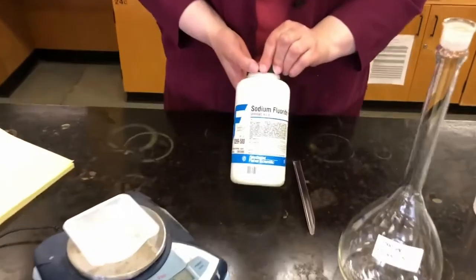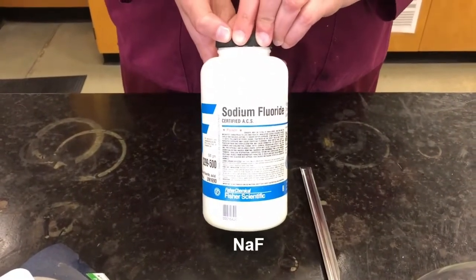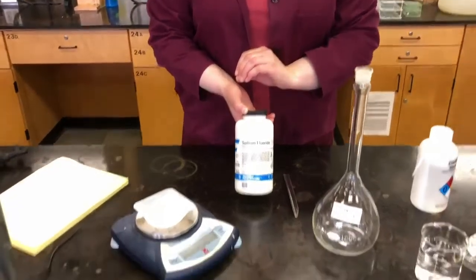So today we're going to start with making up a series of fluoride standards. So we're going to use sodium fluoride for that. So this is the powdered form of sodium fluoride. So how do we know how much we have to weigh out to make up our stock solution? Well, there's a calculation we can do to give us that amount.